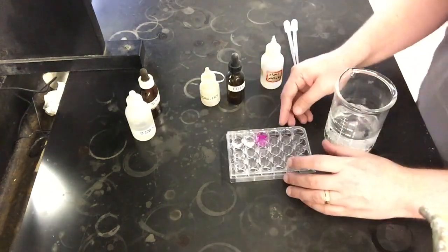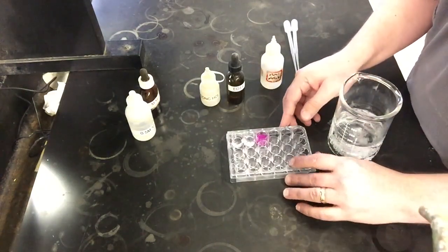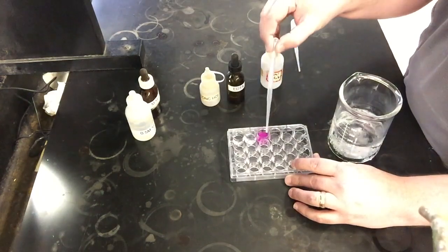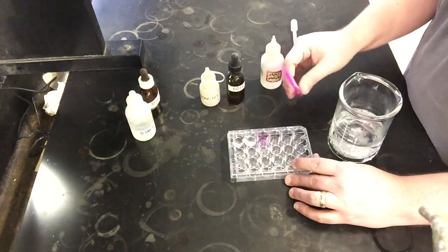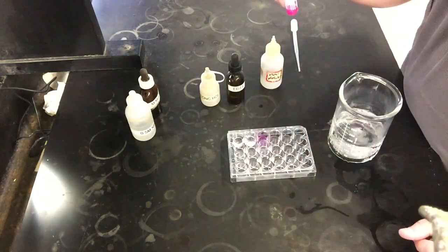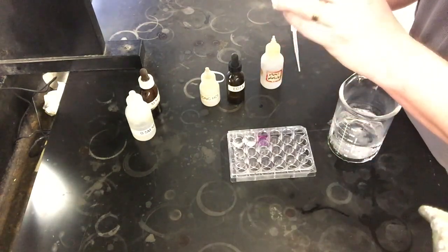And so what I'm going to do now is similar to the first part of the experiment where we did the temperature examination. I'm going to take this up into a pipette. So I'm just going to pull all this up into a pipette. And then I'm going to let this all drain down a little bit. Try not to spill too much of it on myself. It's not stuff you really want to be touching. Honestly, probably should have gloves for this.